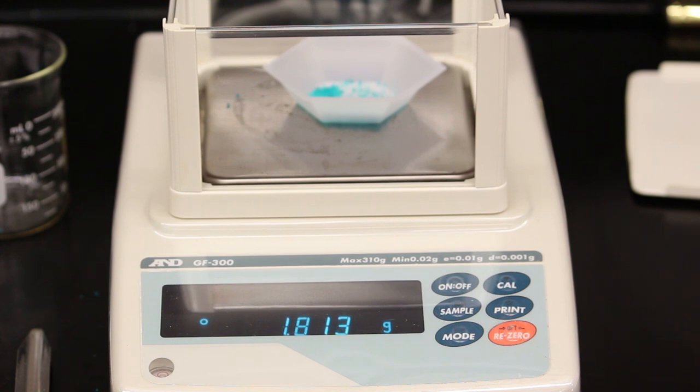Don't throw away any significant figures. You may notice the last digit, or last two digits, change until the balance stabilizes. That's okay.